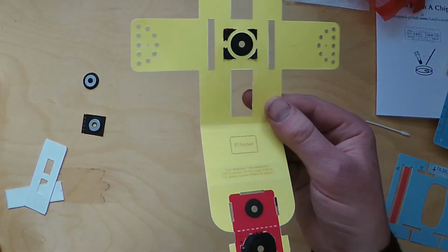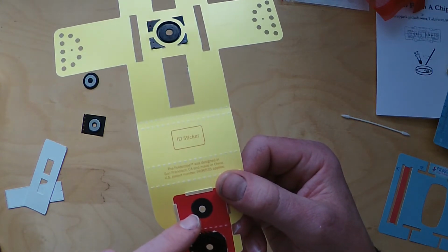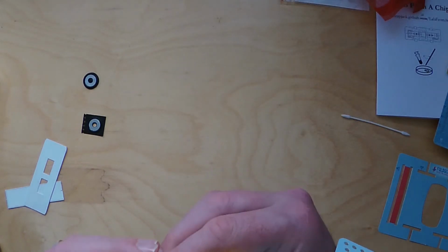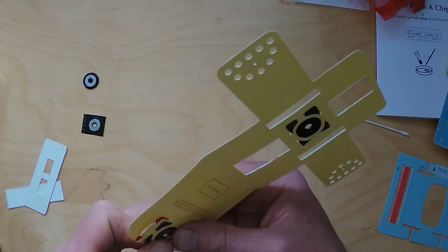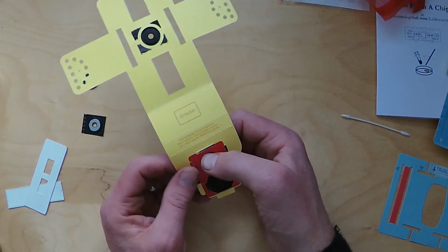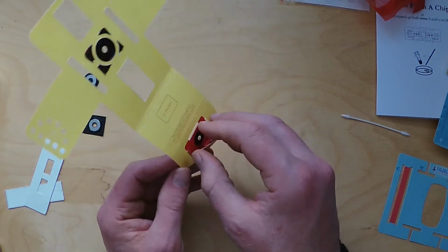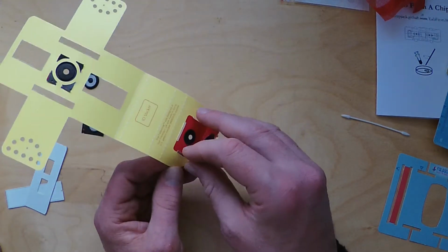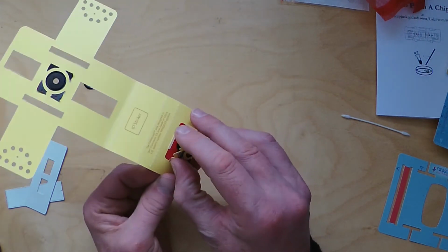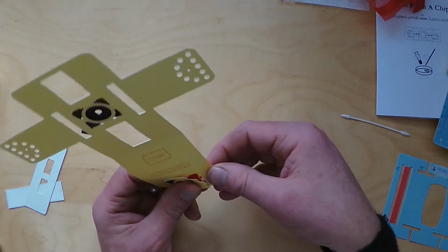Okay, the next step is to fold and lock the bottom flap here. You probably want to do a fold there first, and you'll see that each of these tabs go into those three slots there. So pop those in there. Again, you have to sort of angle them in, fold it a little bit.